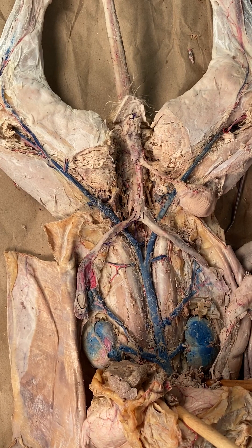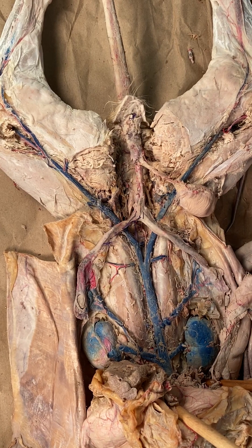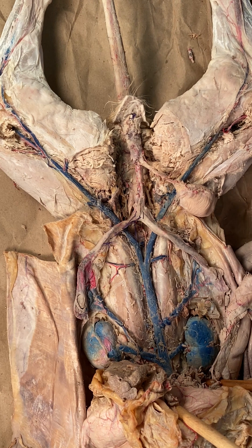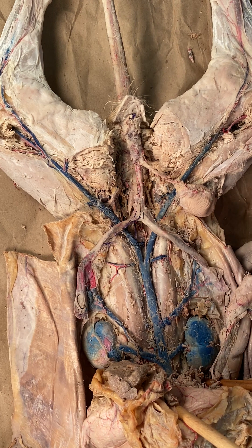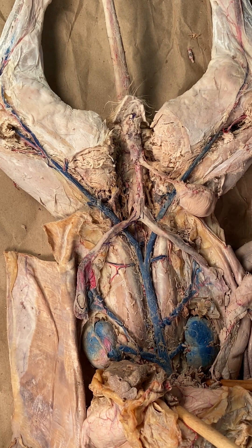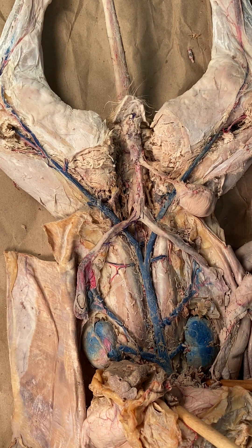This cat was dissected to demonstrate the reproductive system of the female cat. So we're looking at a female cat here.